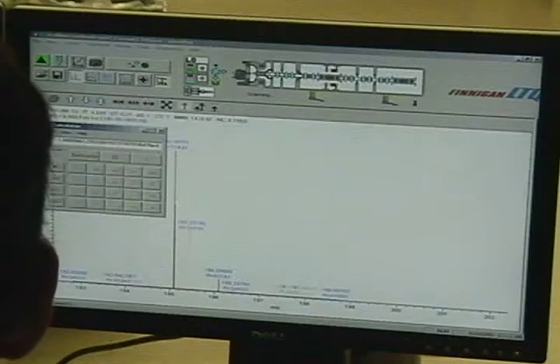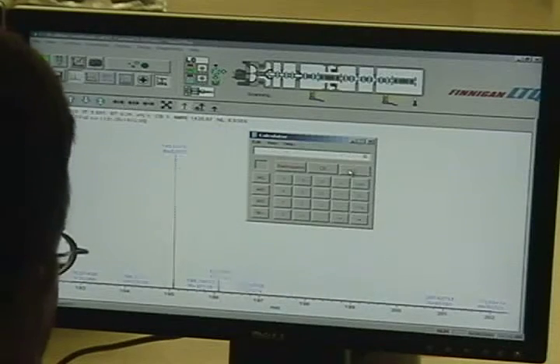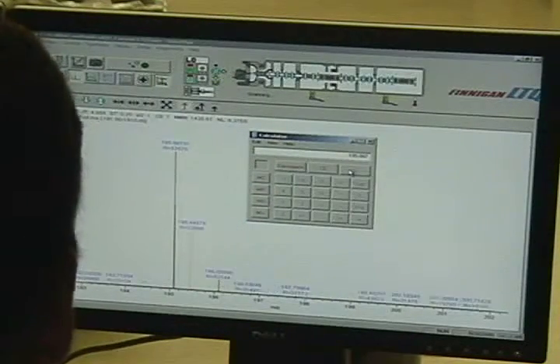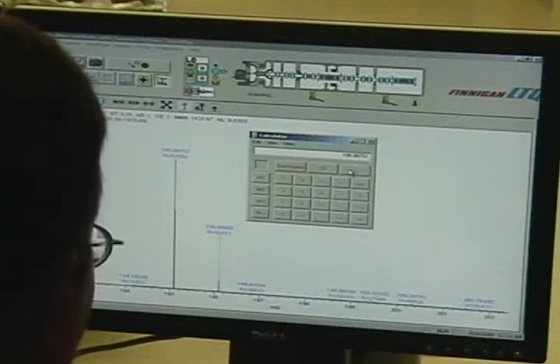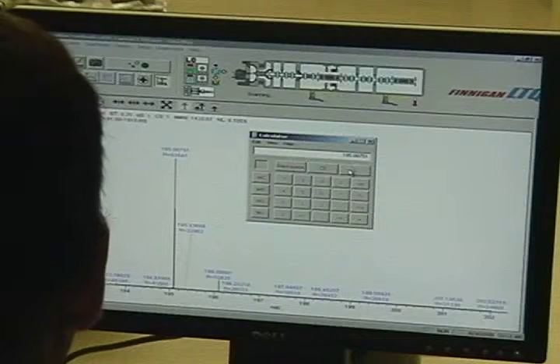Okay. So this is just to prove that the instrument did what it was supposed to do. But even up to 3E6, it's supposed to get sub 2 ppm, isn't it? No, that is not the case. So that's like 20 ppm up there? The problem is instrument to instrument, that AGC is kind of a questionable number. So we always say 5E5 sub ppm is when the instrument's working properly.